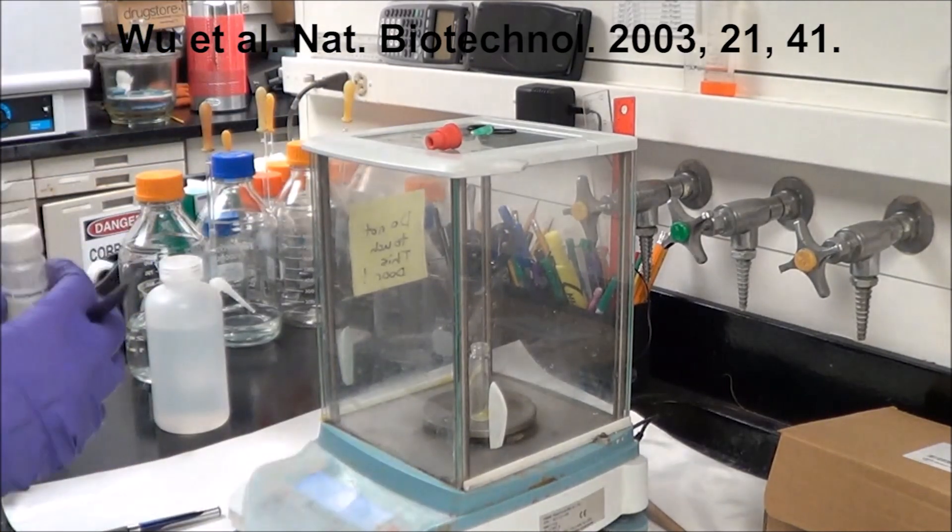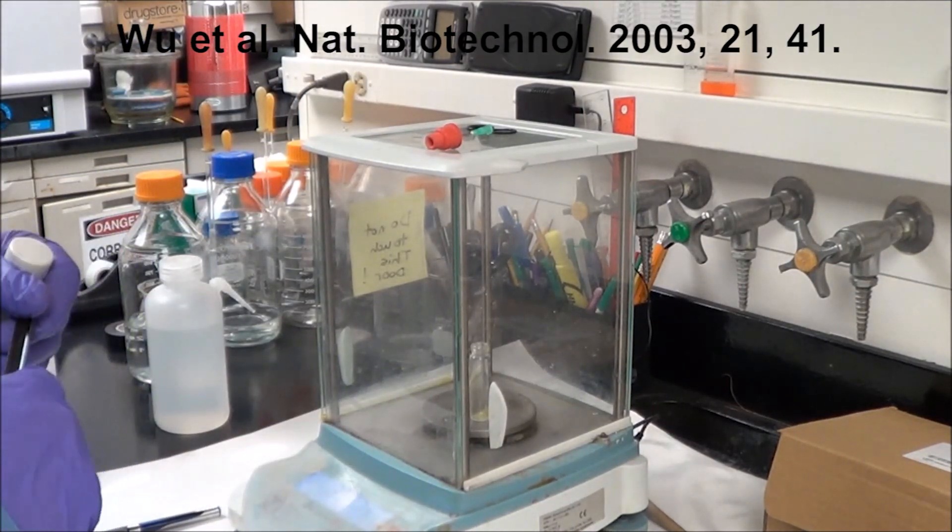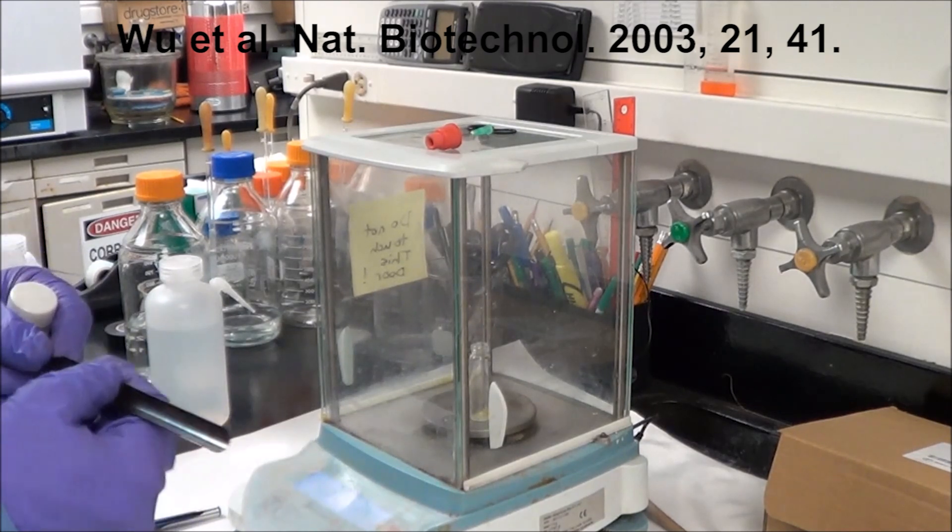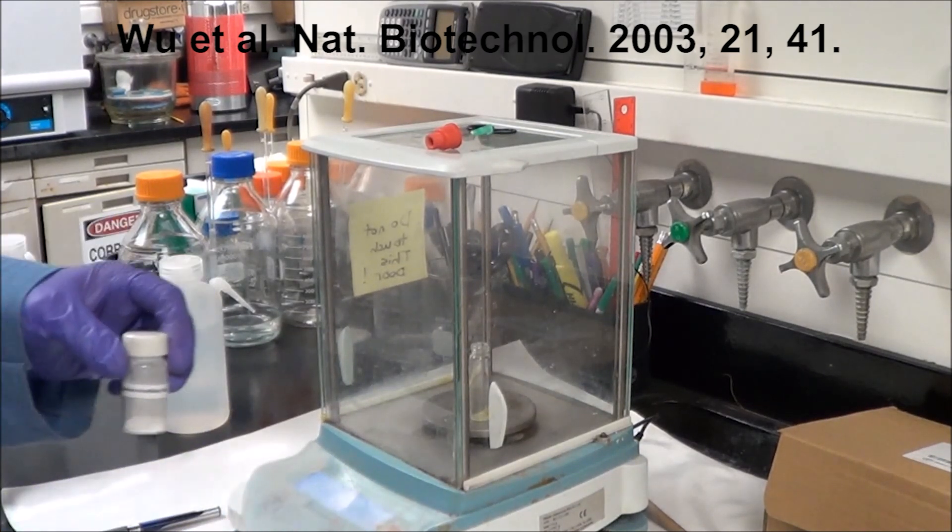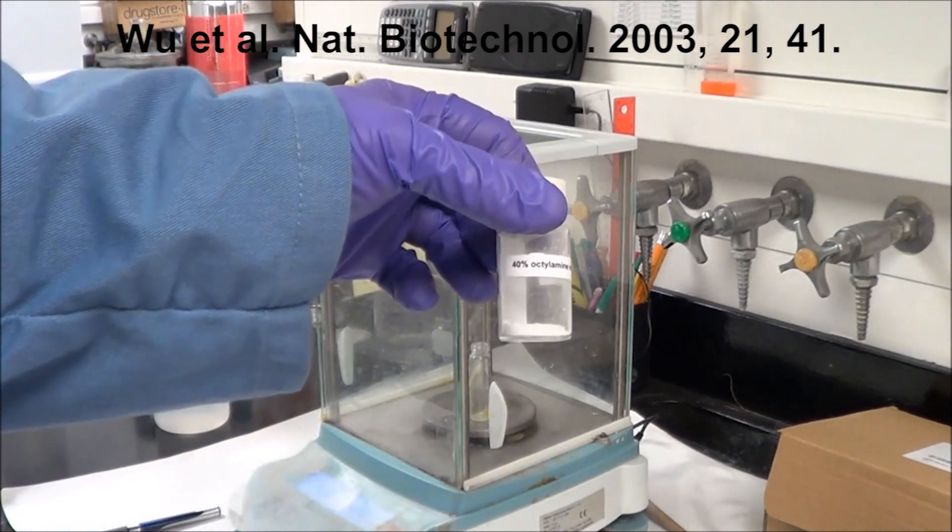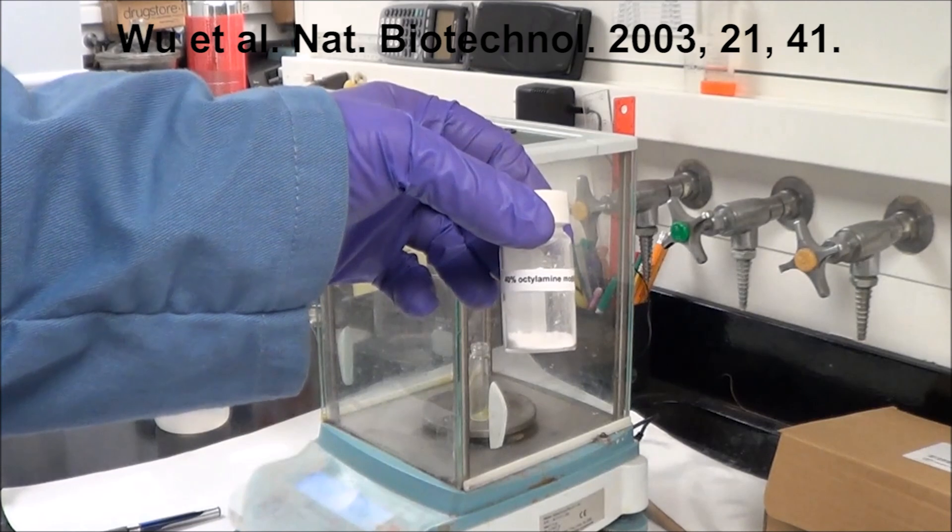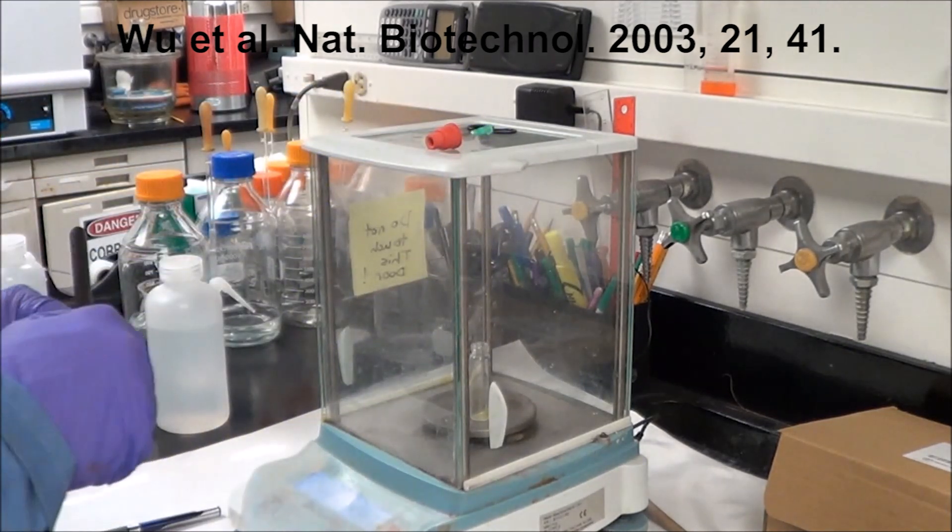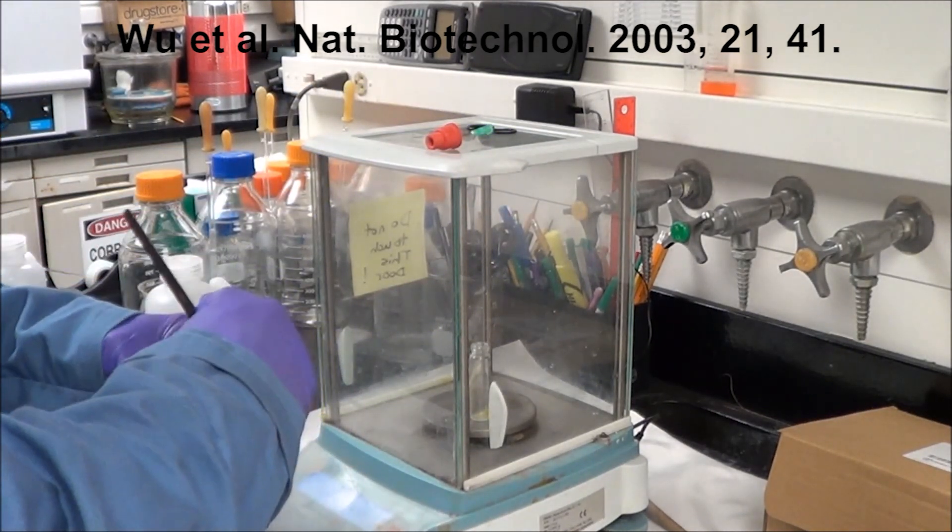The polymer that we're using is the rather ubiquitous 40% octylamine modified polyacrylic acid. The polyacrylic acid was originally 1800 molecular weight, and you do have to synthesize this yourself. It's not terribly difficult, but if you've never done synthesis before it can be quite challenging.